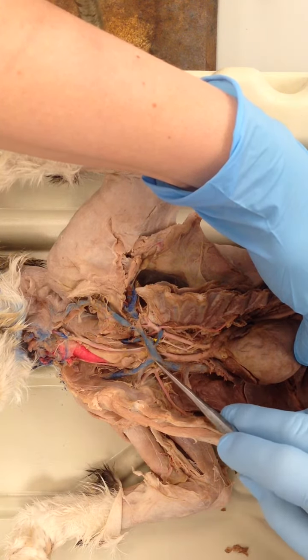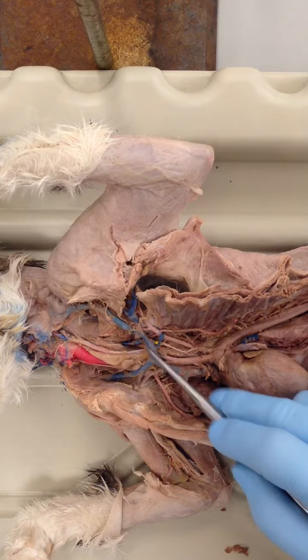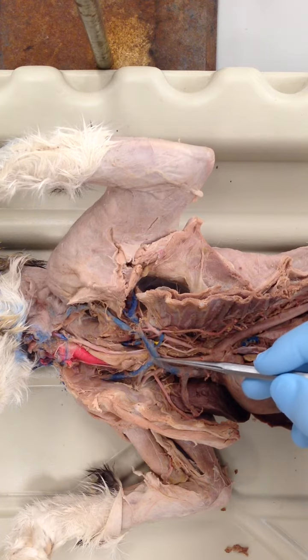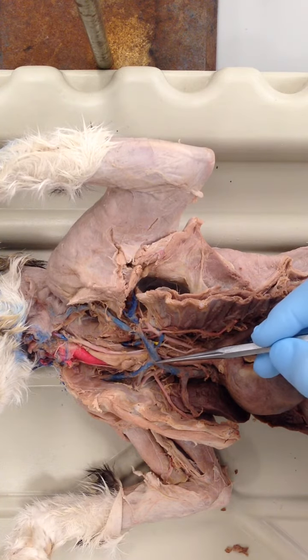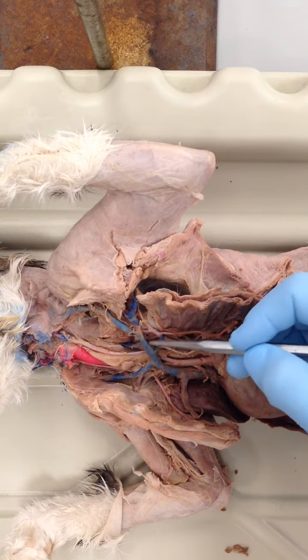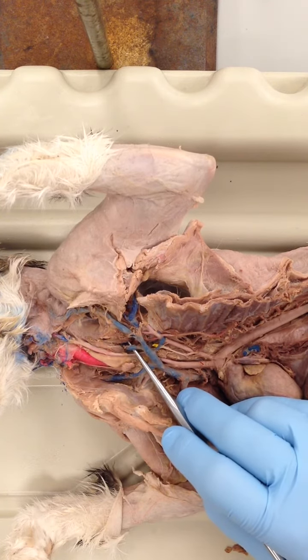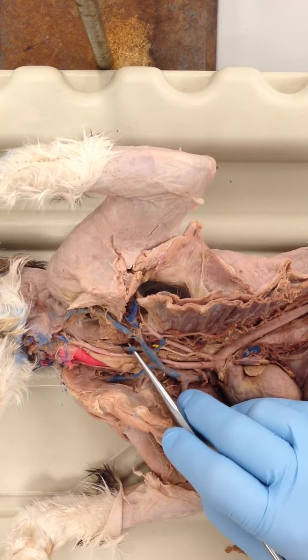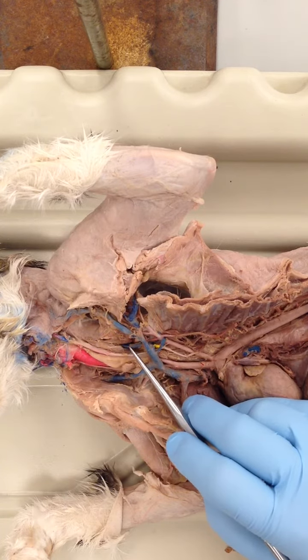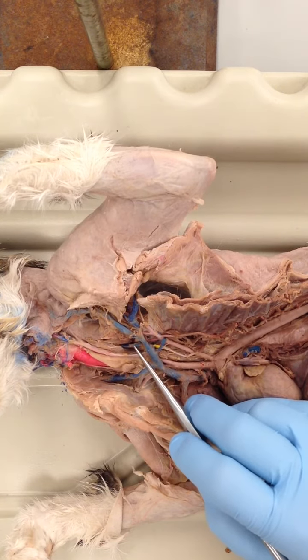The superior vena cava then follows up towards the head and branches further into the brachiocephalic veins. These first two major branches are brachiocephalic veins. From those, if we look towards the left brachiocephalic, notice you have this major branch off of the left brachiocephalic. This is actually the vertebral vein. I'm sorry, the vertebral vein. Notice it's a pretty large vein. It's not on your list, but I just want to point it out so that you're aware of that branch right there.